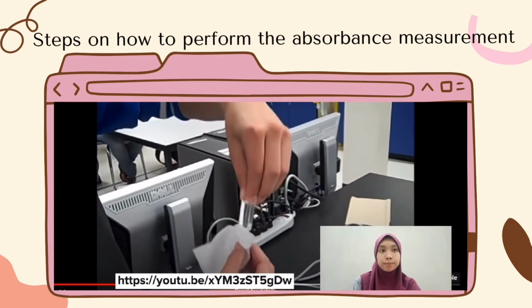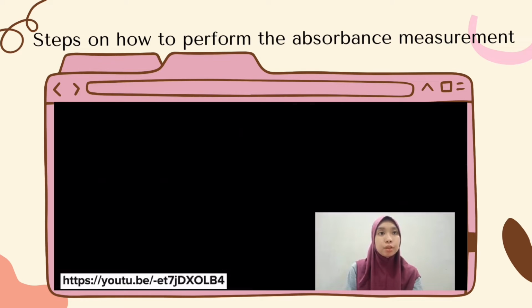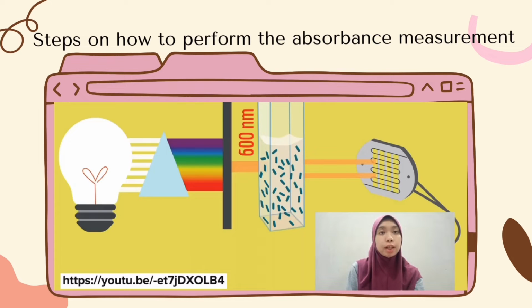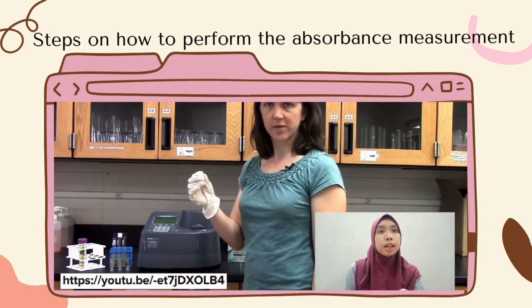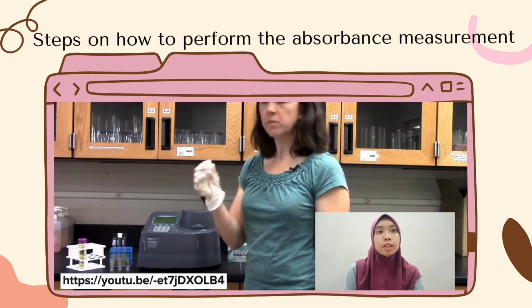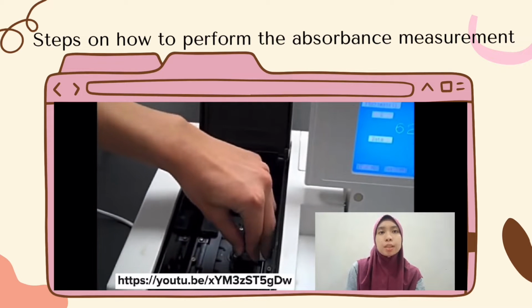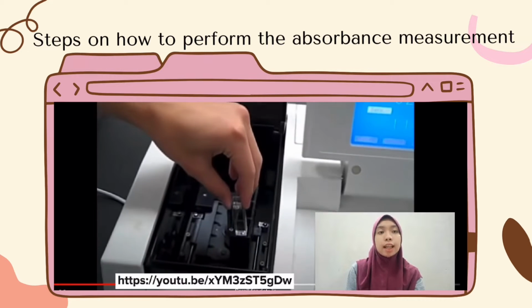Spectrophotometers are also calibrated by using a blank solution that we prepare containing all of the components of the solution to be analyzed. The blank solution in this experiment is deionized water. The blank solution acts as a control that contains the chemical solvent in which the solid is being analyzed and dissolved. This is because the water and the cuvette also absorb light, so the spectrophotometer will not measure the water and cuvette light absorptions.